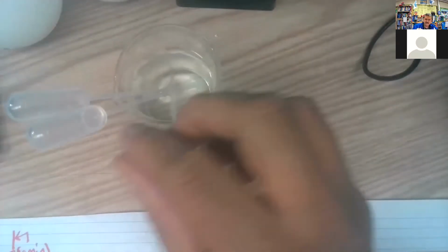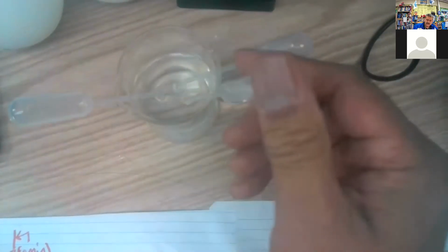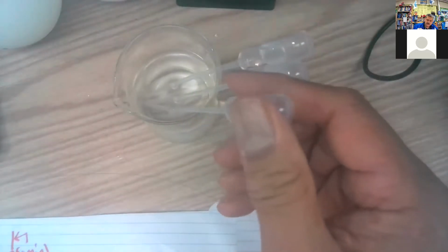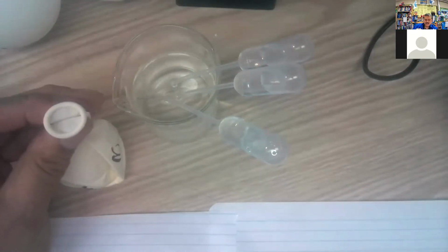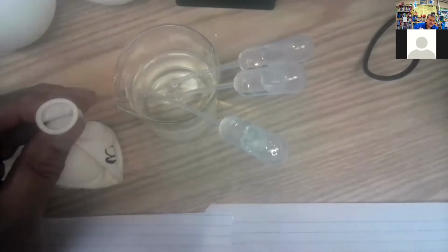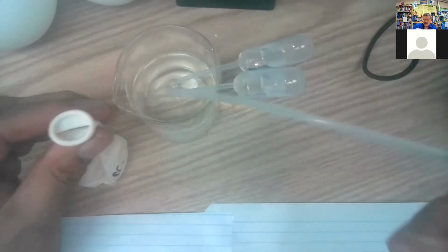That 3rd one going. Refill these guys. There's 1, there's 2, there's 3. So I got 3 ready to go. And then when I throw it back in there, it'll fill up. By the time I need it, it'll be ready. Okay, so here we go. There's 3. And ready.